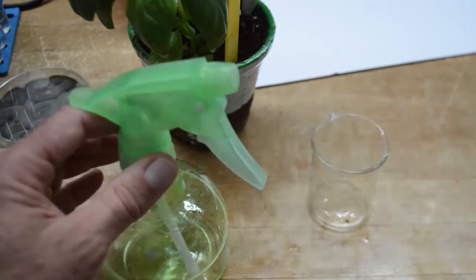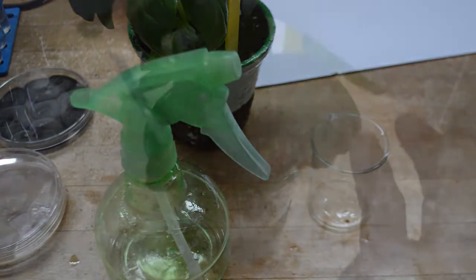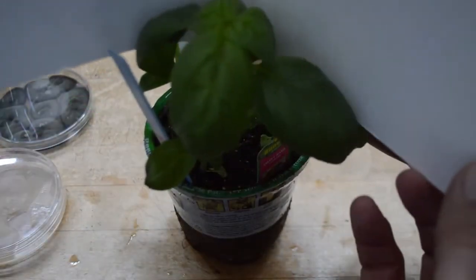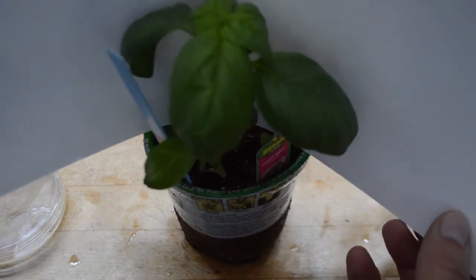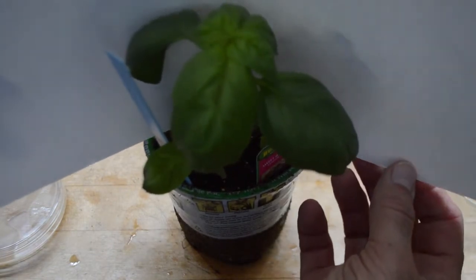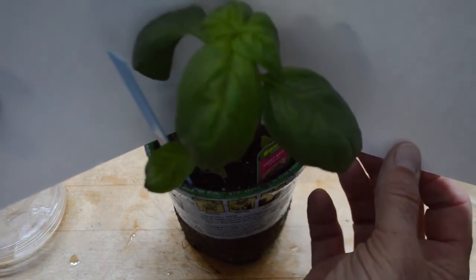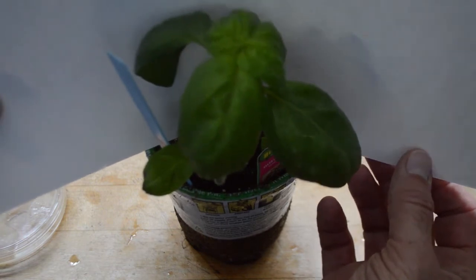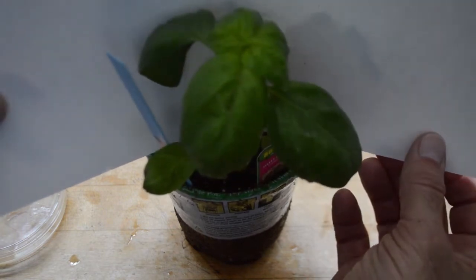Since the isolations were done from lesions on a basil plant, we have a pot that has three plants. One plant was inoculated with each fungus, leaving one plant as the un-inoculated control. Leaves were sprayed until runoff occurred.